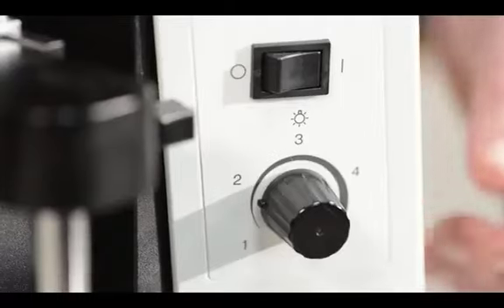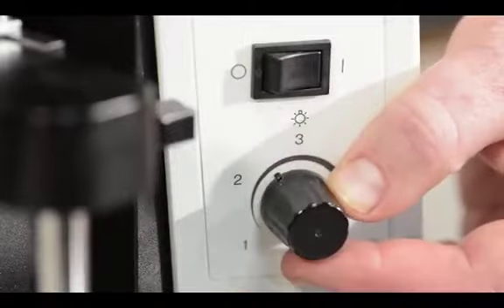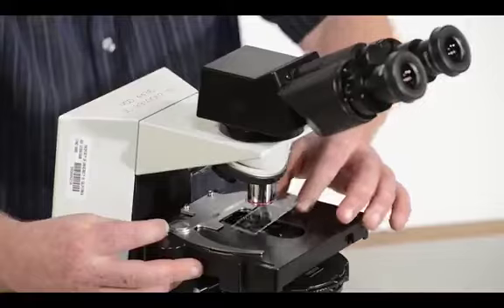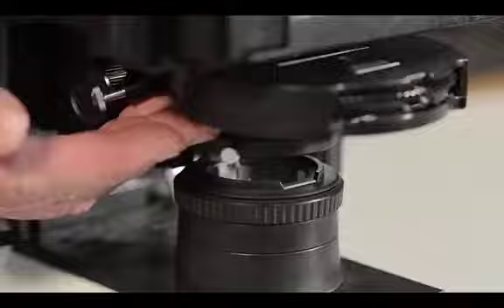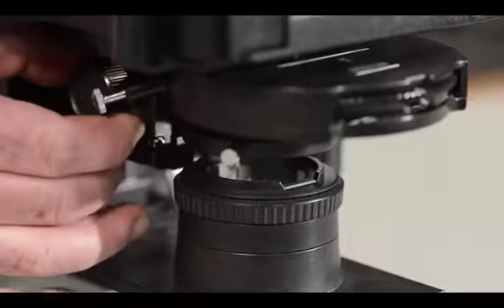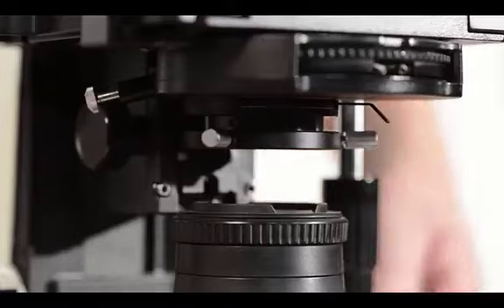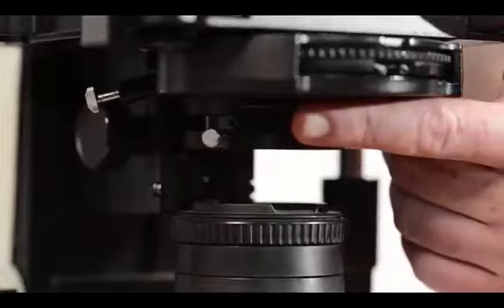Next to the focus knobs, we have a power control switch and a knob that controls light intensity. On top of the stage is the stage clip, which is used to secure the slide. The stage movement is controlled by knobs on the right side. Attached to the underside of the stage is the condenser, which is mostly used to focus the light coming through the specimen. It also contains a number of filters and other parts, most of which we don't use in Biz 2C. Beneath the condenser is the diaphragm and light source. We use the diaphragm to control the diameter of light directed towards the specimen.